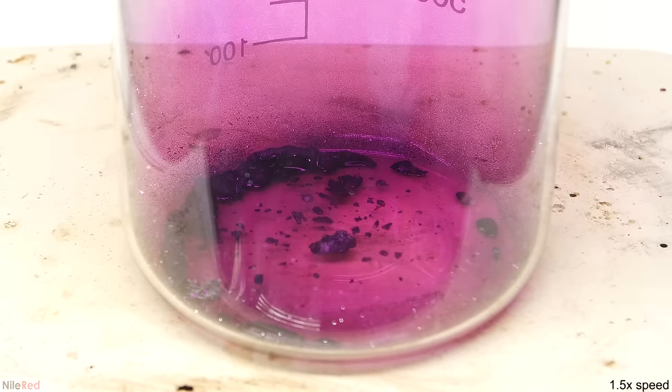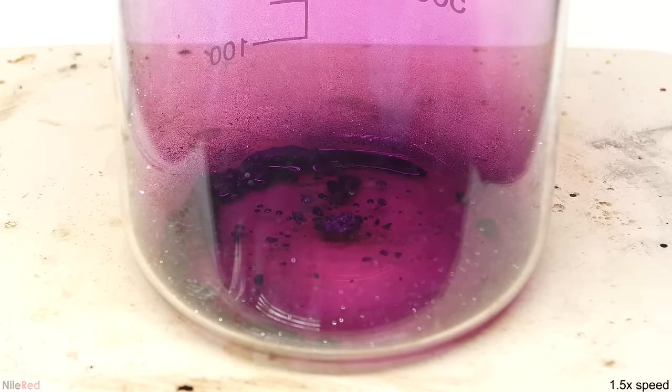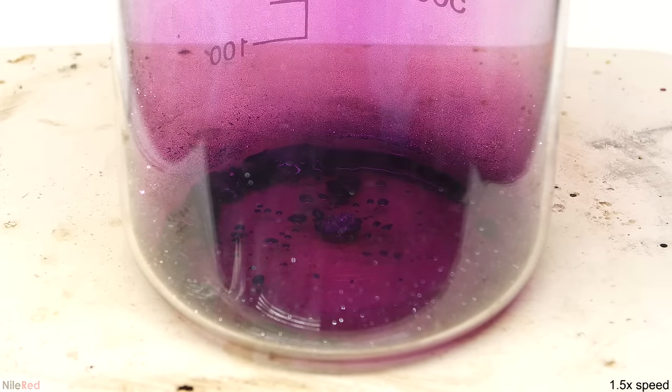As I continue heating, everything eventually liquefies, and from that point on, it's technically evaporation and not sublimation. So, if you actually want to be demonstrating sublimation and not just deceiving the students, it's really important to keep the temperature below the melting point.